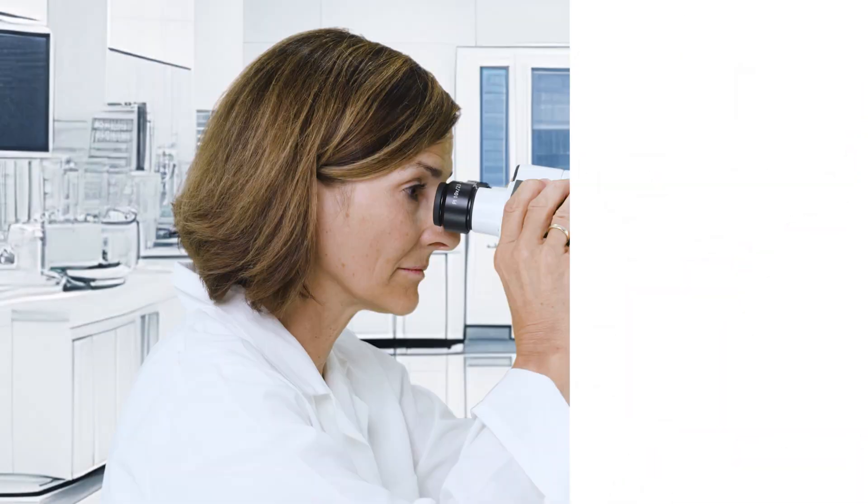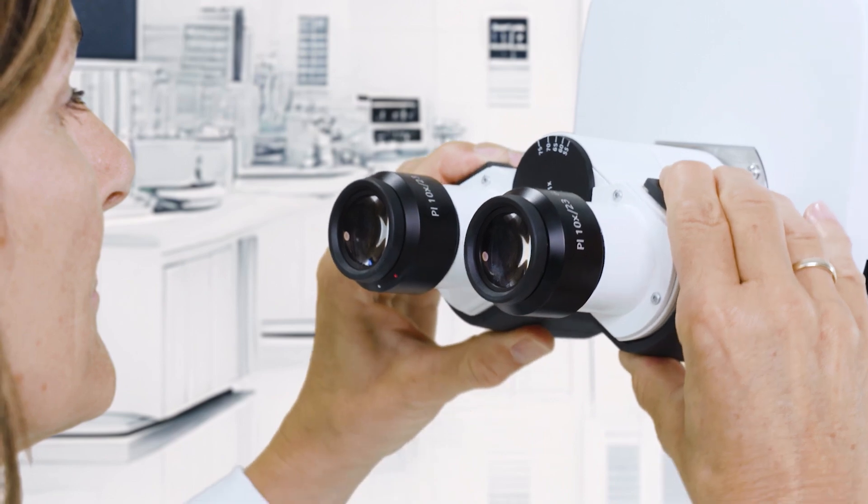Optionally, orient the eyepieces to adapt the viewing angle for enhanced comfort. Try out different positions to find out what works best for you.